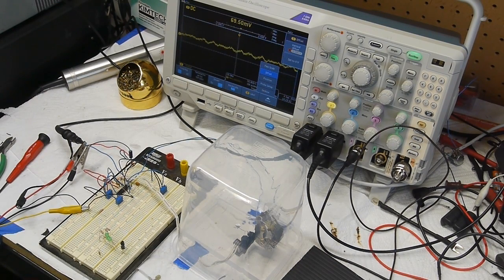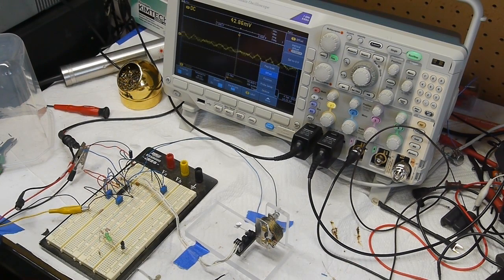Okay, so now we're reading about 70 millivolts. So the delta there of maybe 22 millivolts corresponds to 76 micrograms. I've been having problems with the plastic cover. I think the static charge on it is actually making the thing even worse than keeping the air currents away.